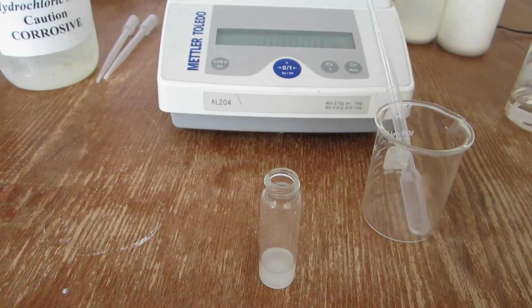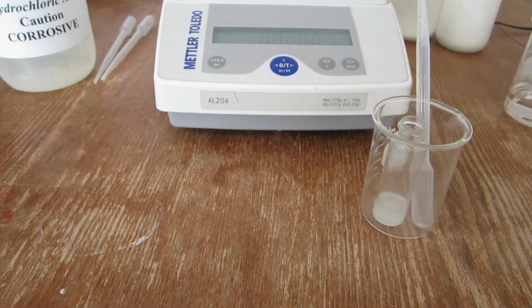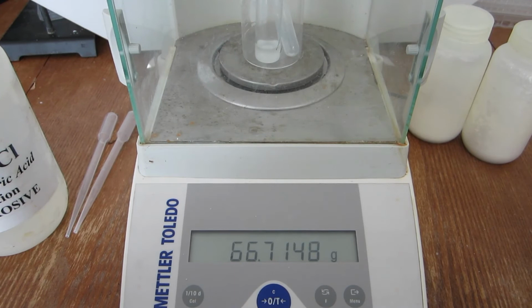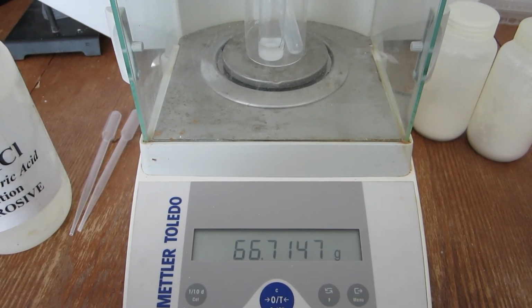After which, the mass after the reaction can be obtained. The final mass reading for after the reaction of trial number 3 is displayed here.